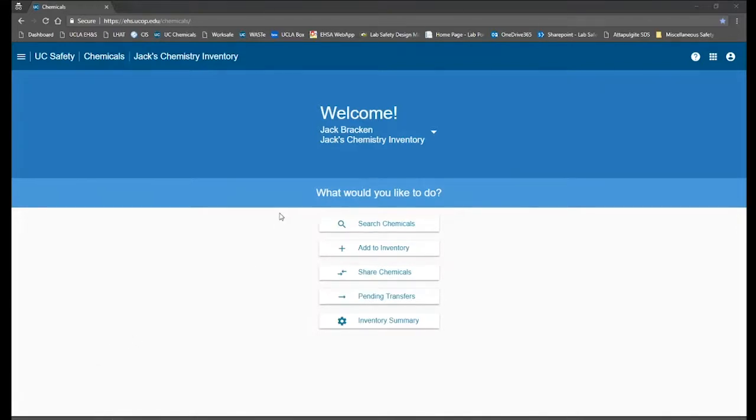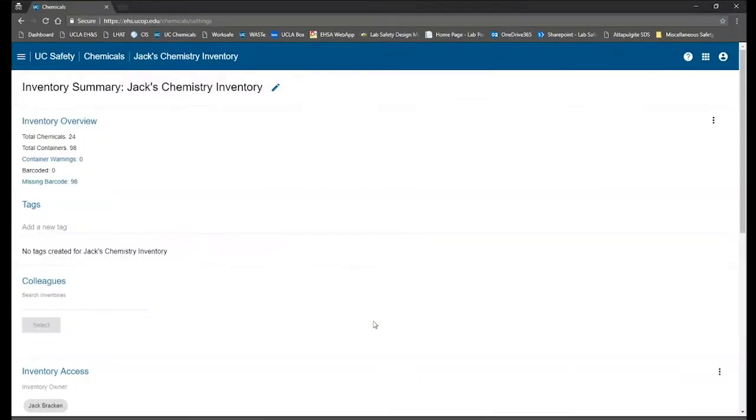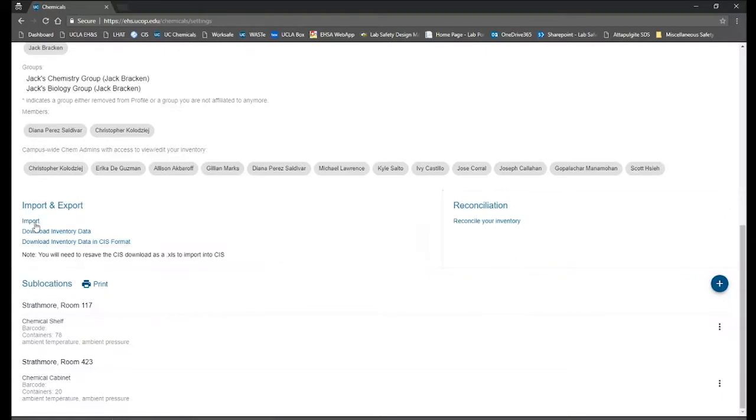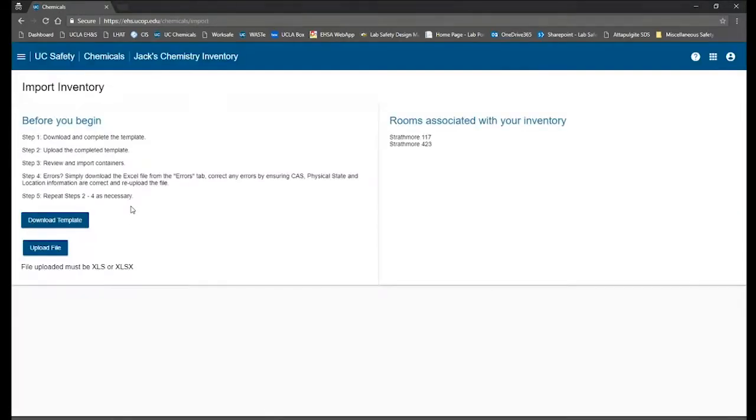So you start in your inventory front page, you go to the inventory summary button, click that, scroll down to the import and export section and click import. Here's where we're going to upload the corrected file. If you'll notice, we're actually on step 4 right now. This is where we got the errors back. We want to correct them and then re-upload them.